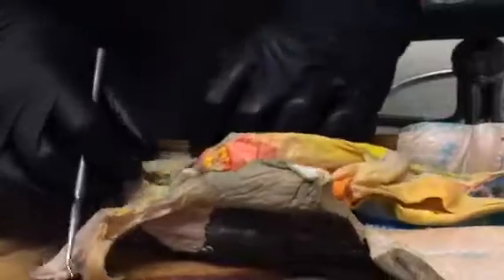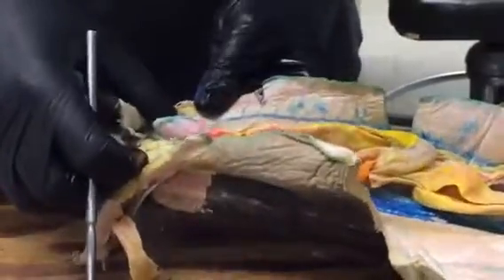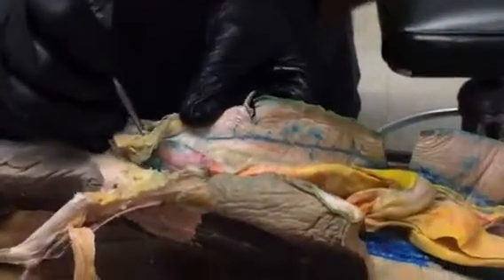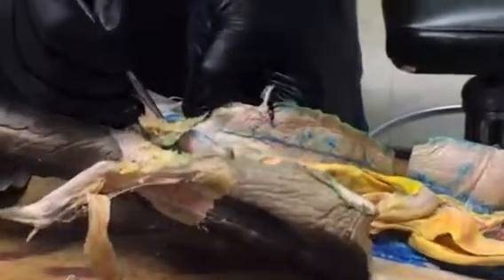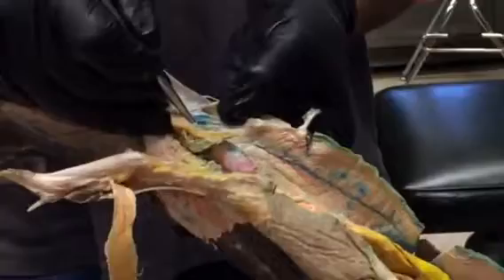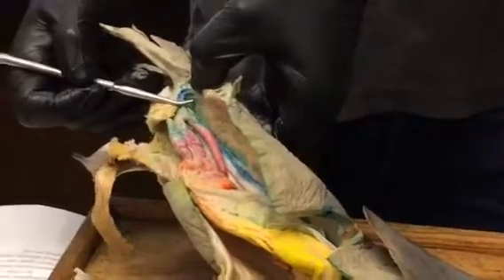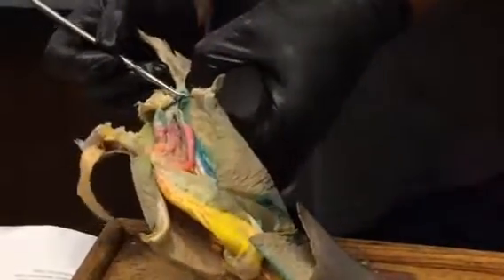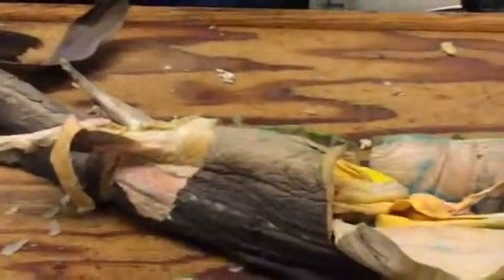Okay. Iliac arteries. Did you guys make that cut? You can see them better over on this side. Is that really red? That looks blue to me. It's red, it just has some blue over it. Oh, good. Okay, because that should be the iliac artery right there. So this is a branch that comes off and runs to the pelvic fins, like we have the subclavian going to the pectoral fins. This is the iliac artery running to the pelvic fin, supplying blood to the pelvic fin. Okay. And that's named for the ilium, which is the hip bone in a mammal.